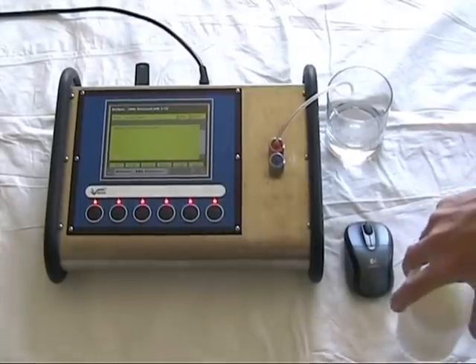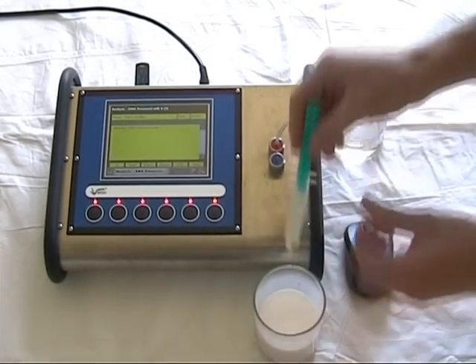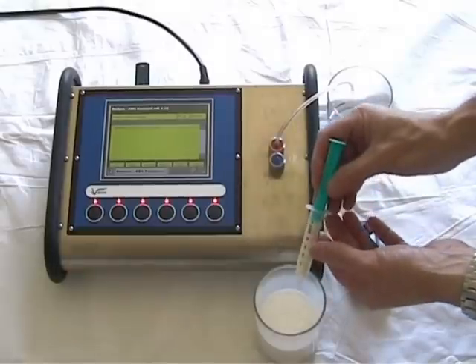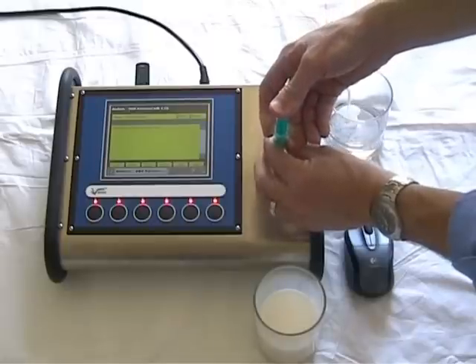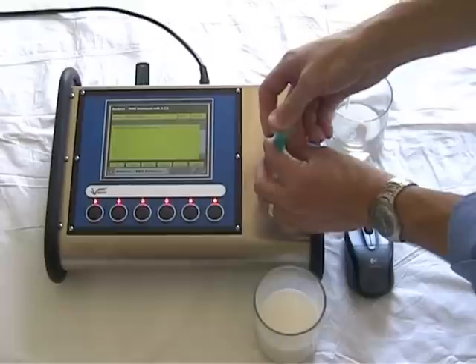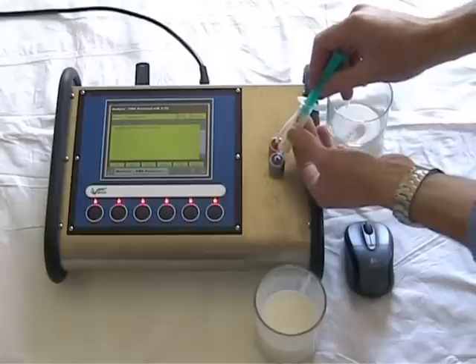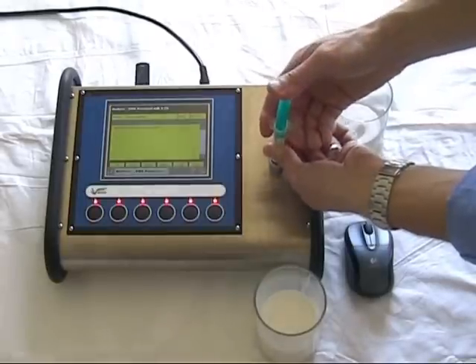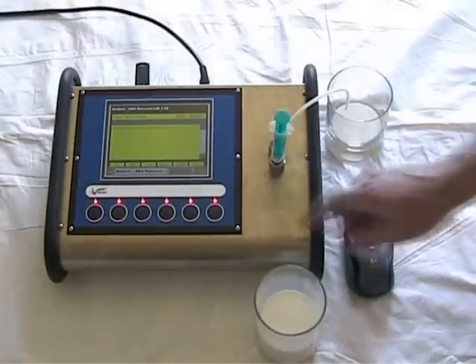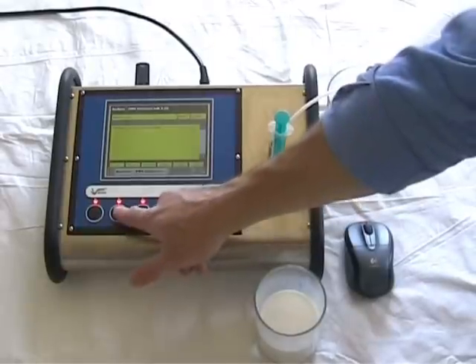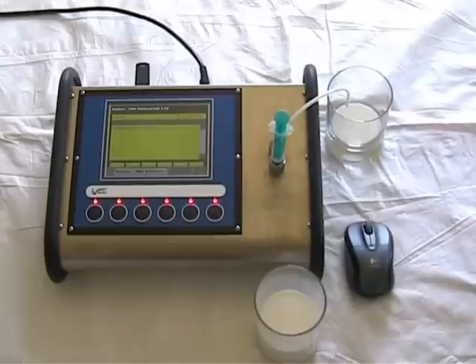Let's make a measurement. I'll inject about 5 ml of milk and follow that through with another 5. I'll now press the start button to begin the measurement. And the reading will take about 60 seconds. Let's take a look.